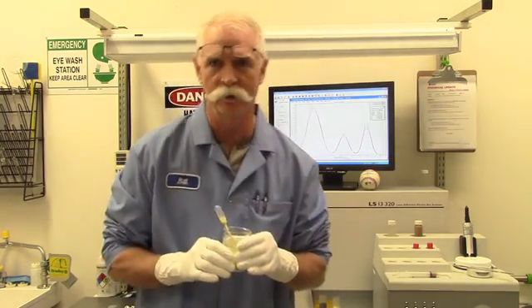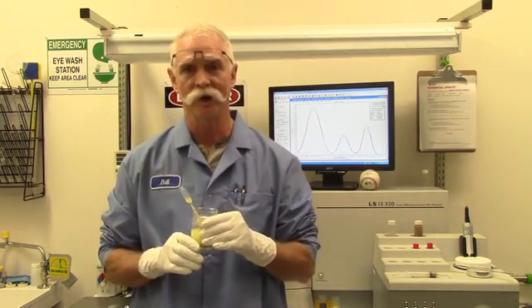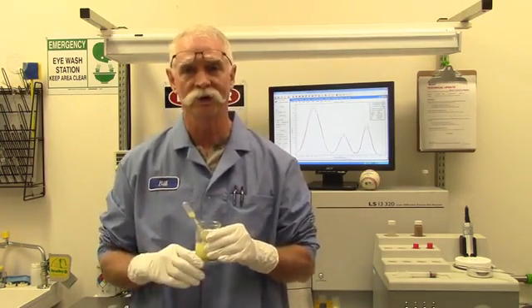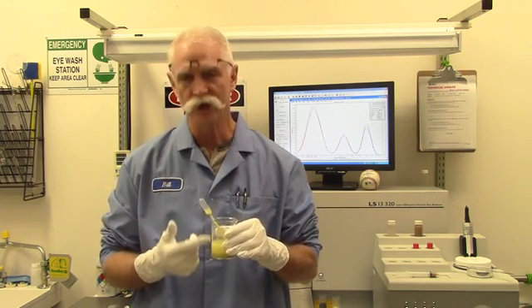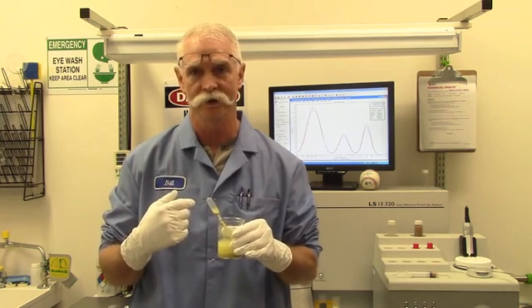In order to properly run your sample, you may need to do some sort of sample preparation before you actually introduce it to the instrument. In the case of the ULM, maybe you have to change the buffer material or the carrier medium, the fluid.